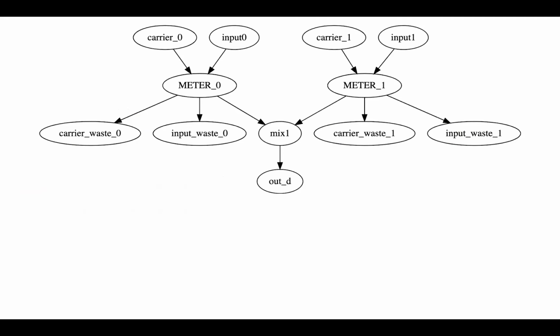Meter components in the current LFR are not pipelined, meaning there will be extra carrier loads and carrier waste when there are multiple meter components in the design. Pipelining to reduce these unnecessary nodes is important as it can reduce the number of ports and the cost.